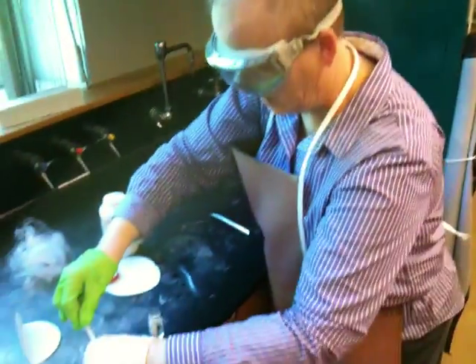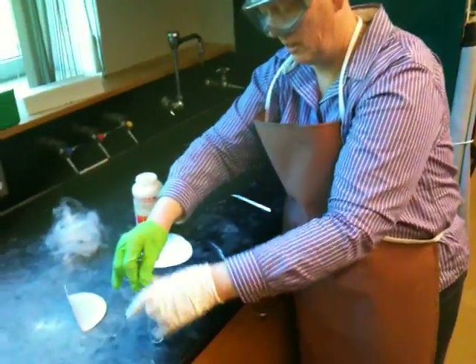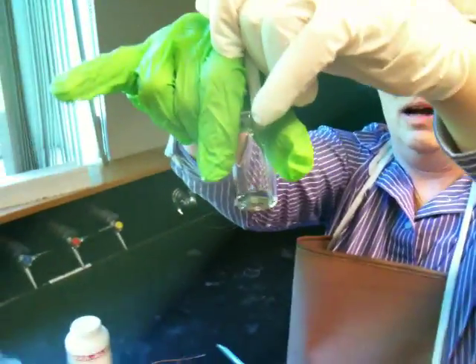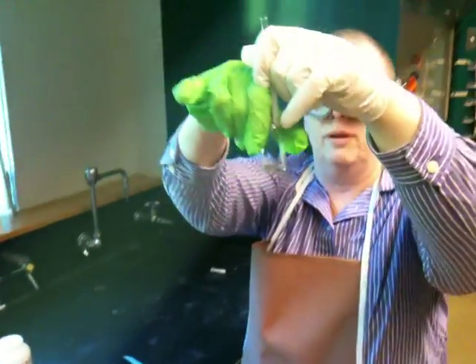Okay, so you can see the liquid in the bottom here. I'm kind of a little shaky there. Like that. Okay? So, you know, anytime you're going to do a drying, review this tape.